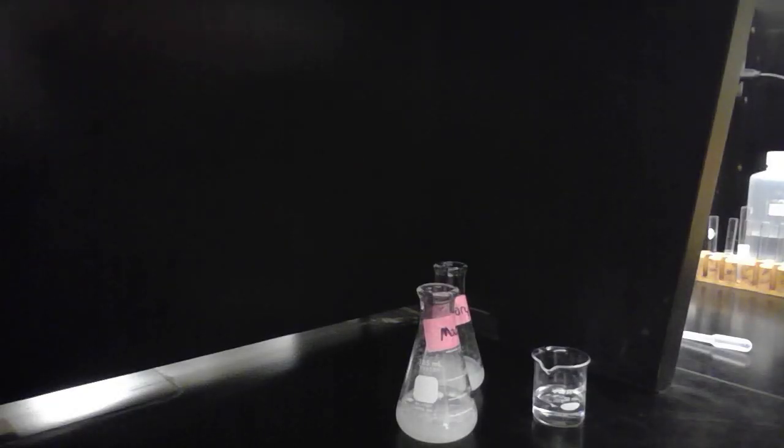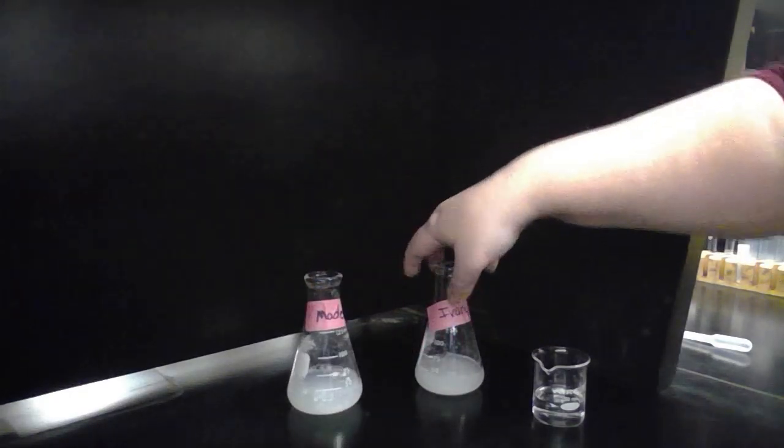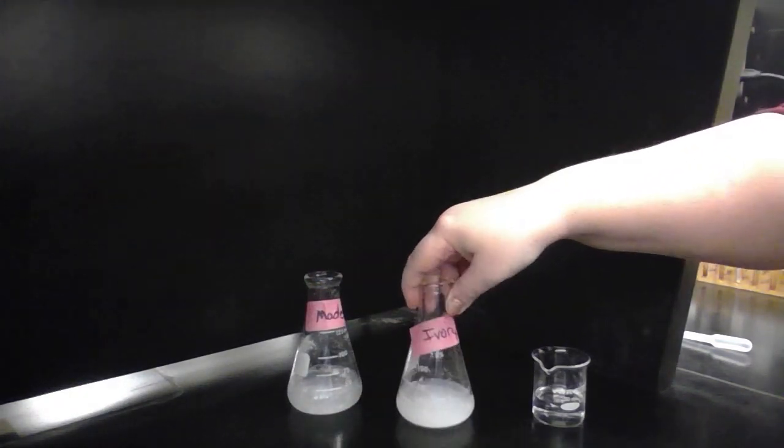Last thing we'll look at is the Tyndall effect. What I'm going to be doing is using a laser pointer and seeing how it interacts with our solutions. First we'll look at our ivory or our control soap.